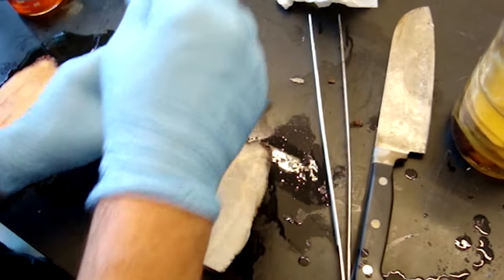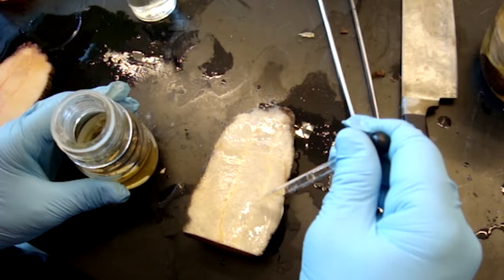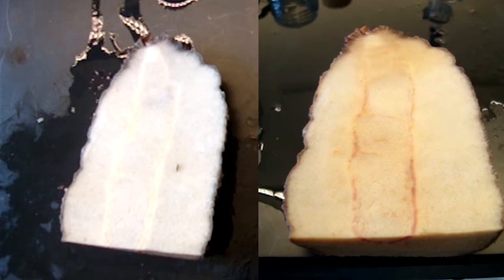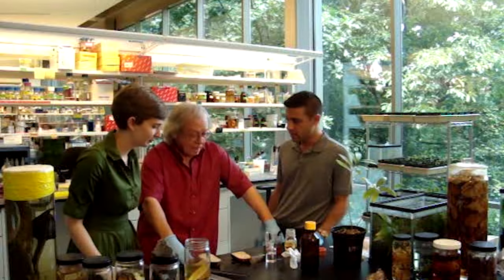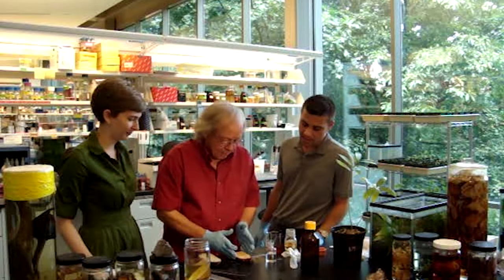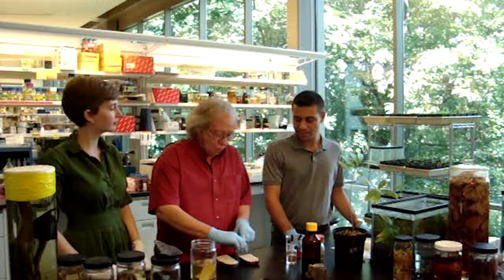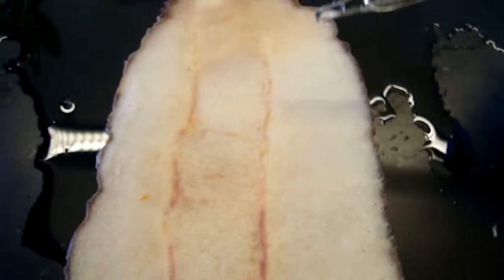Dennis is actually adding acid to this because you need a little bit of acid to activate the stain — it's going to make everything in the vasculature bright red. Now that it's red and we've waited a few minutes, can you tell me what we're seeing here? What we're really seeing is the stem of the plant as it grows. We've looked at these xylem cells, which are really tubes — they're dead at maturity — and they have this woody wall to them, so they act like plumbing, just like a series of pipes from the roots to the top of the plant.